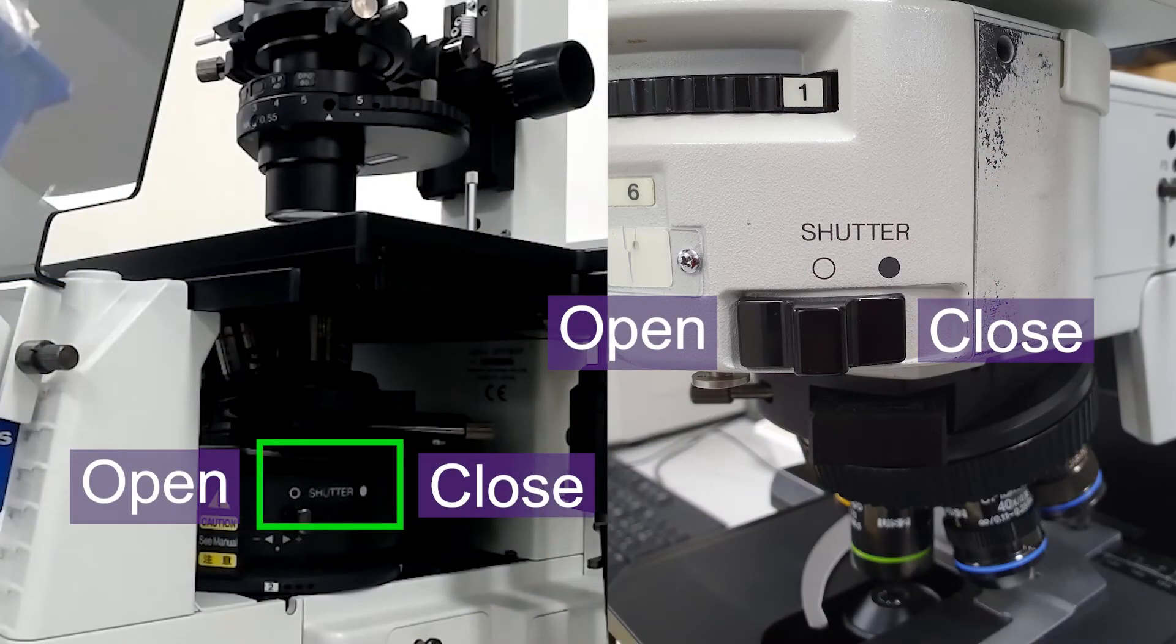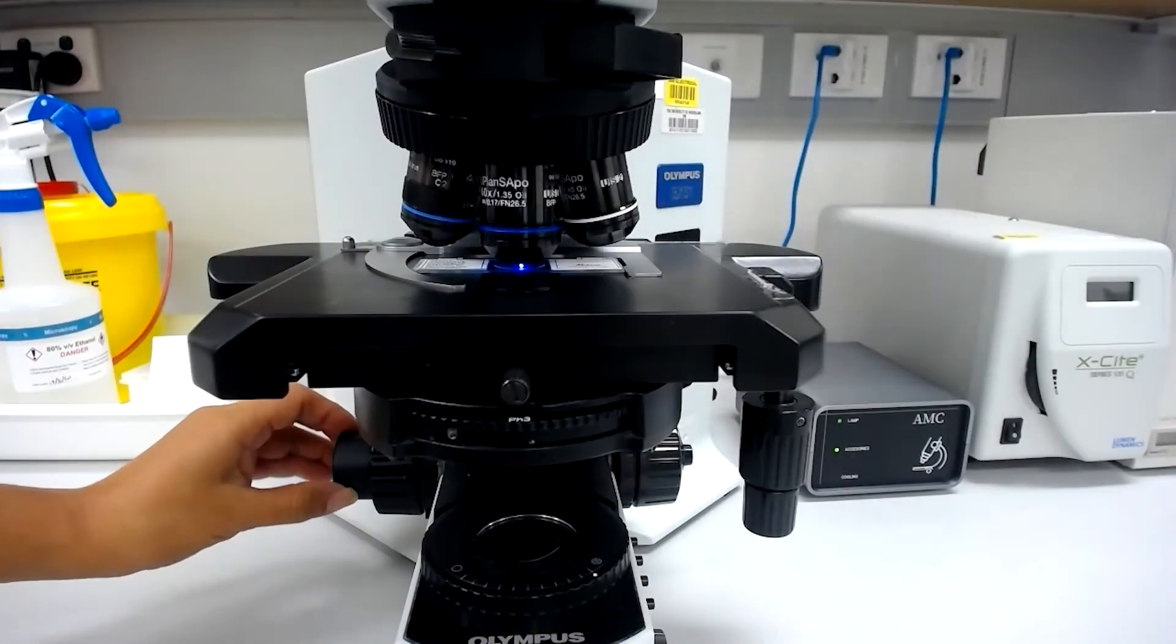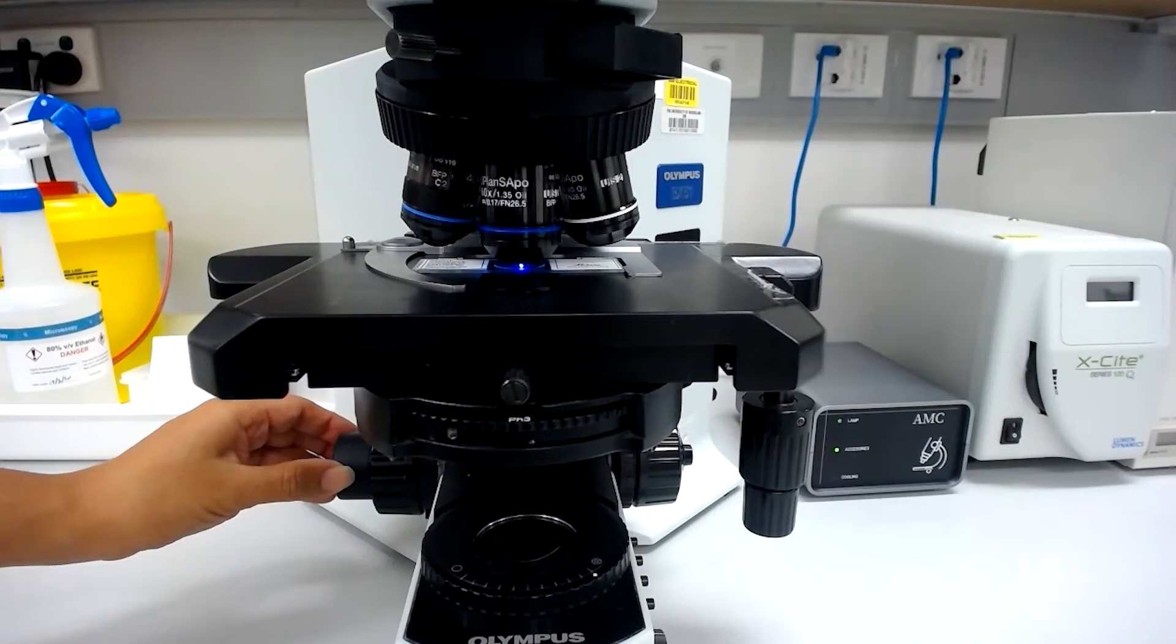Open the fluorescent shutter to illuminate your sample. Now focus on your sample again, and you may find the focus has shifted.